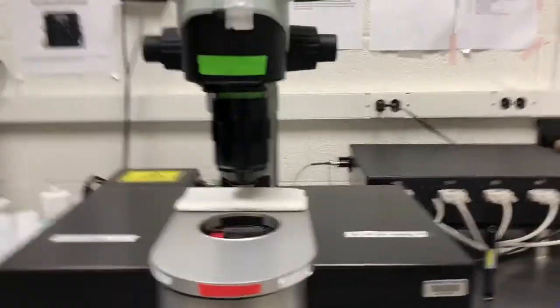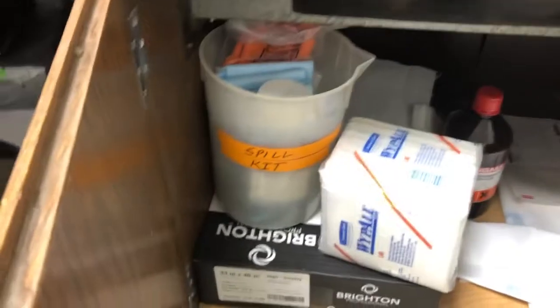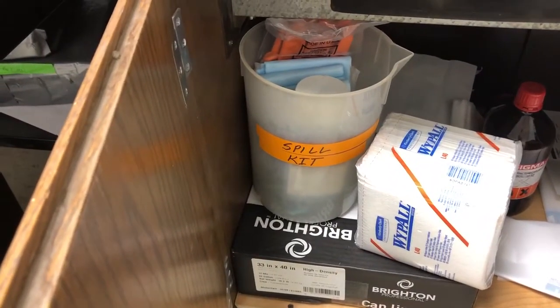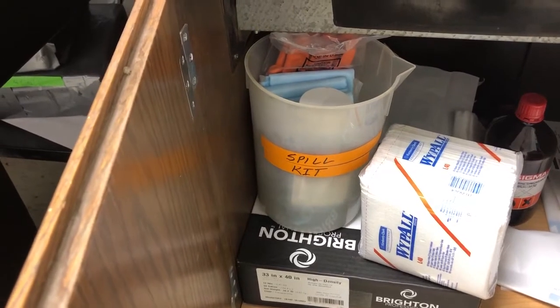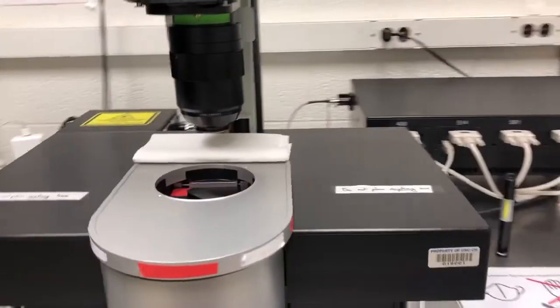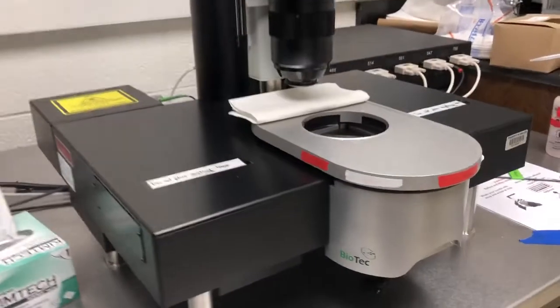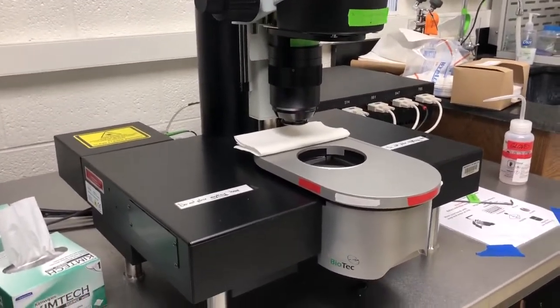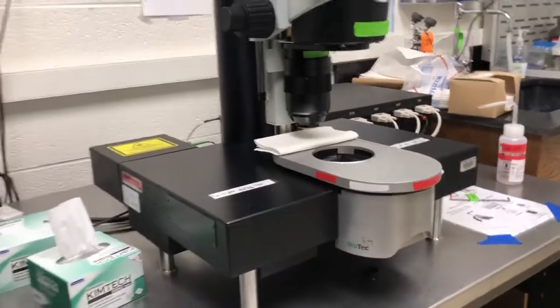If you do have a massive spill for whatever reason, there is a spill kit in here that you can use to contain it, which has absorbent pads as well as gloves. But in many years of using the system, everyone has been very mindful. We've never had to use a spill kit, we've never had problems, which is not to say they can't occur. I've seen major spills on systems, and they aren't pretty—they cause catastrophic damage. So enough about the DBE.